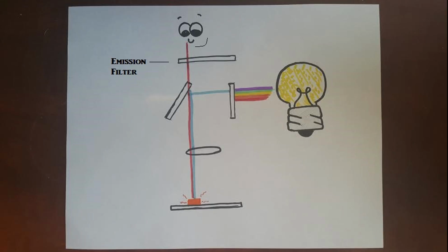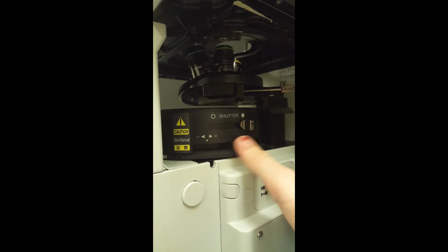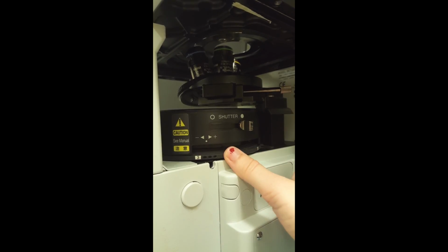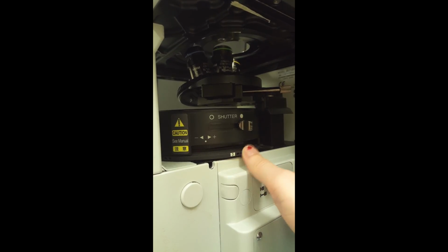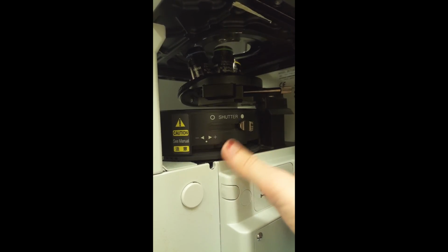microscope's eyepiece. Here we can see a turntable which changes the excitation filter on a real fluorescent microscope. Although the filter is contained inside the microscope, we can easily observe the change by observing the filters act on samples in the dark. In this video, I am changing the excitation filter from a wavelength which best activates DAPI stain to a wavelength that best activates FITC stain. All of this work culminates in beautiful pictures of cells, tissues, and other samples that scientists use fluorescent microscopy to observe.